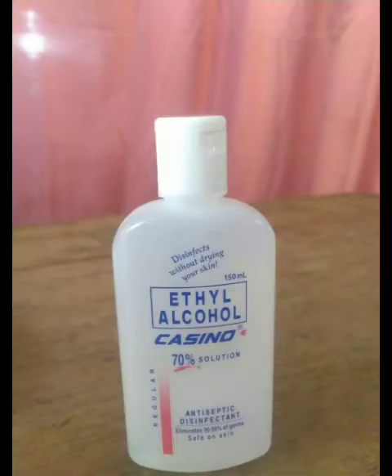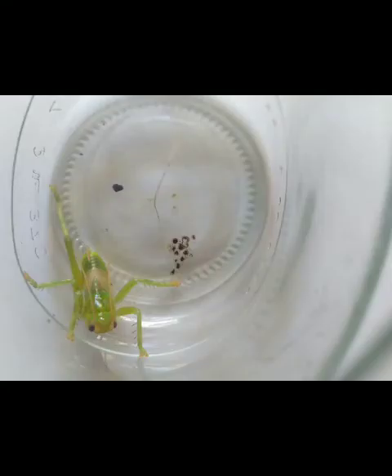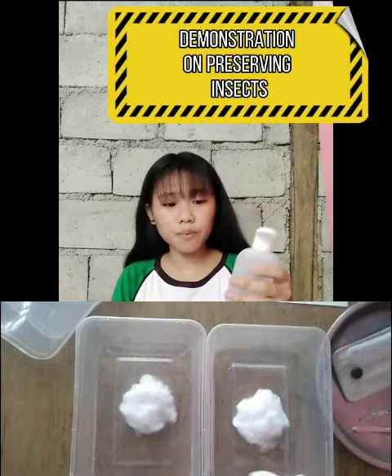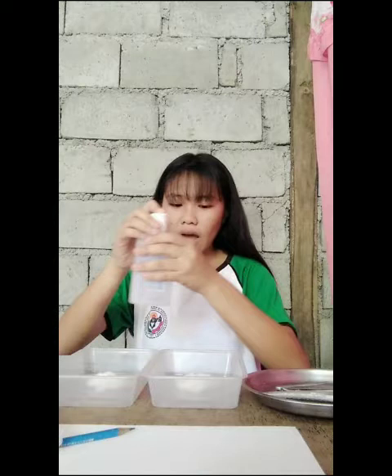Before we start, I will consider the materials that I will be using. I just poured the 70% solution alcohol into the containers and I prepared cottons to pin the insects on.